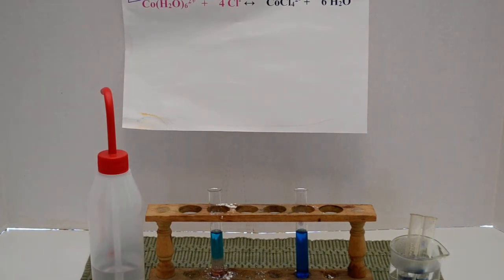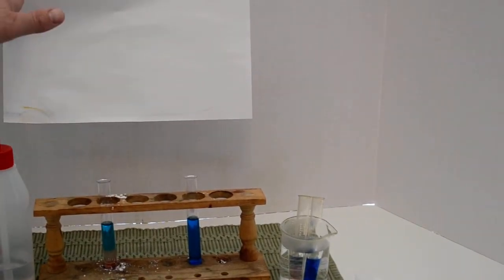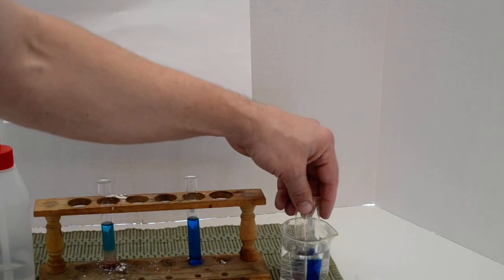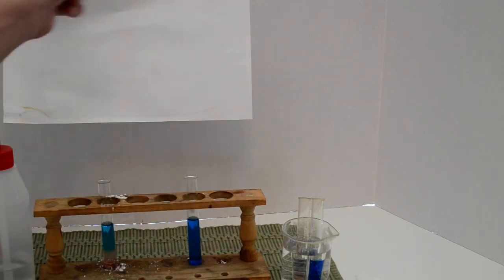Okay, now last thing here. Over here, we added heat to the mixture. So I added heat by putting these two tubes in boiling water. And I don't know if we're going to see this one in time, but I can see it here. It looks like the blue tube is staying blue, and I don't know if you can really see it too well, but it looks like the pink tube is starting to turn blue. So when I add heat in the form of just putting these tubes, these equilibria, in this boiling water here, the blue one is staying blue, and the pink one is turning blue.